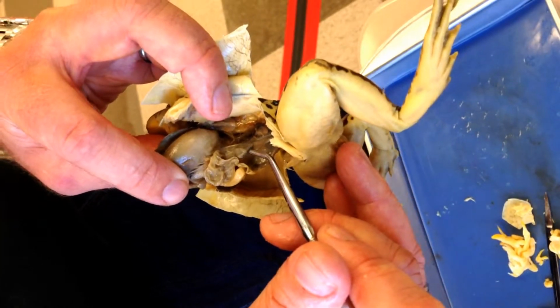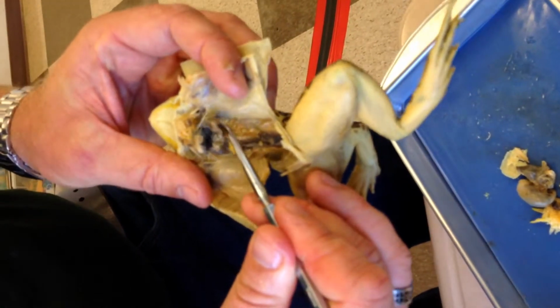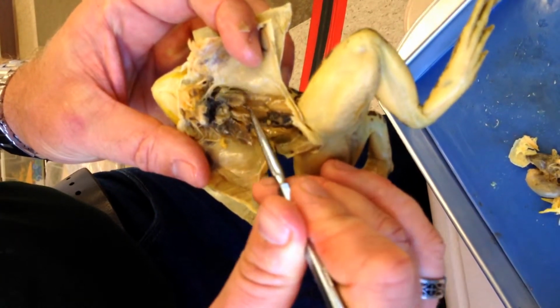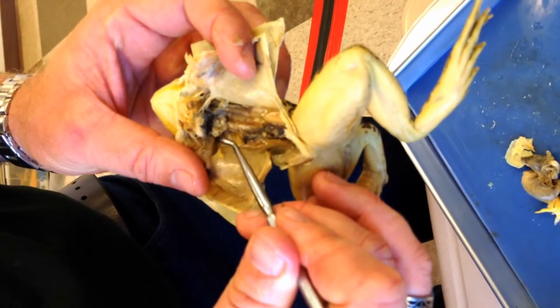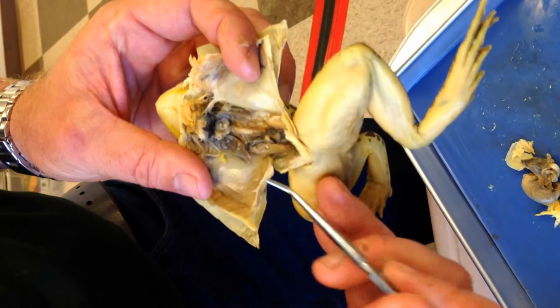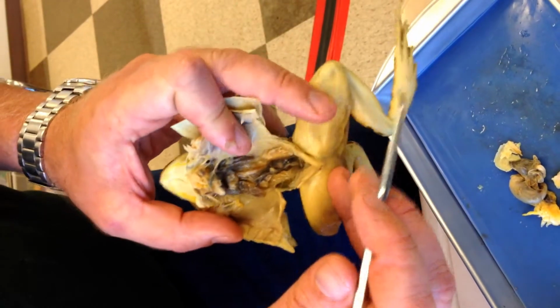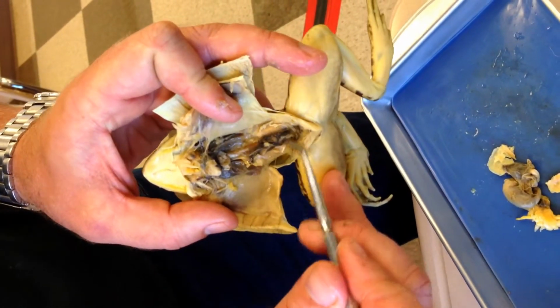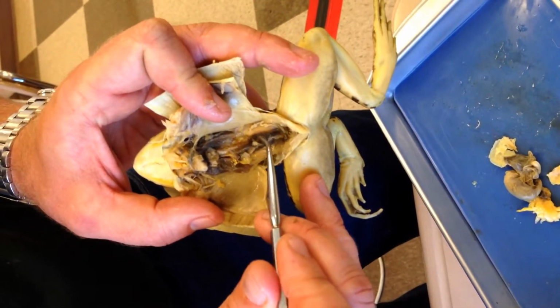Okay, go ahead and pause. Number 18. There are two of these little brown organs. After you remove the digestive system, you can see two of these brown organs. So this is number 18. What are these? Then another set of brown organs, number 19. There's two of them down in the bottom of the abdominal cavity against the back. Number 19 right here.